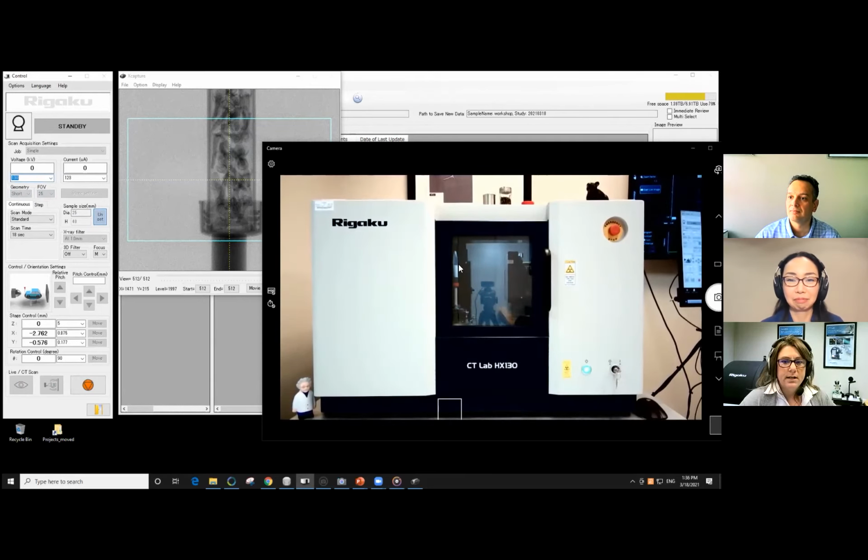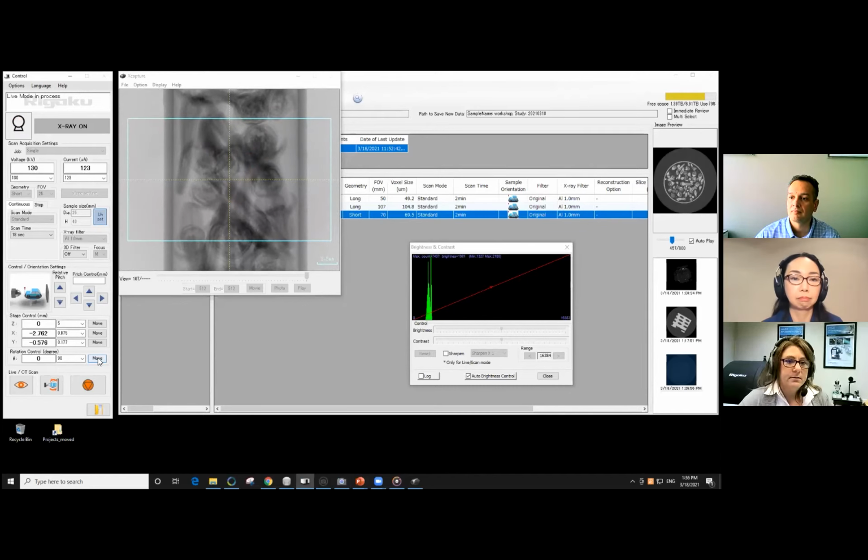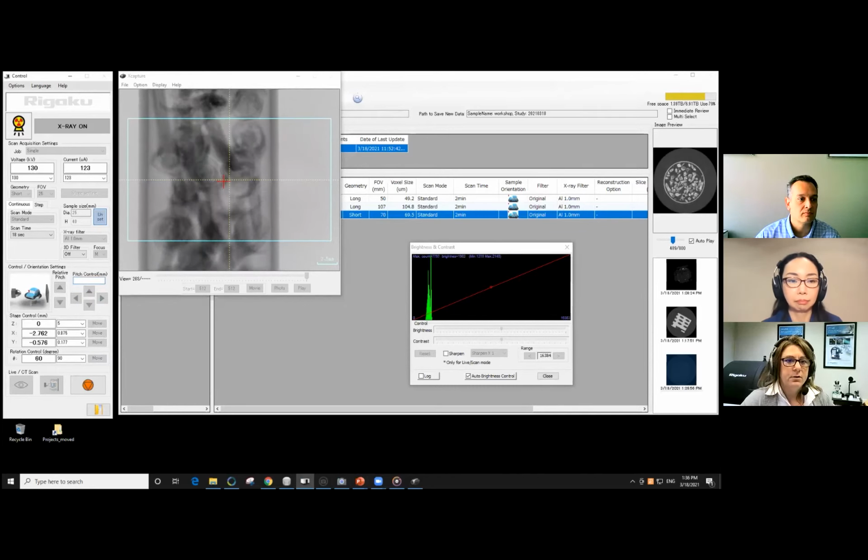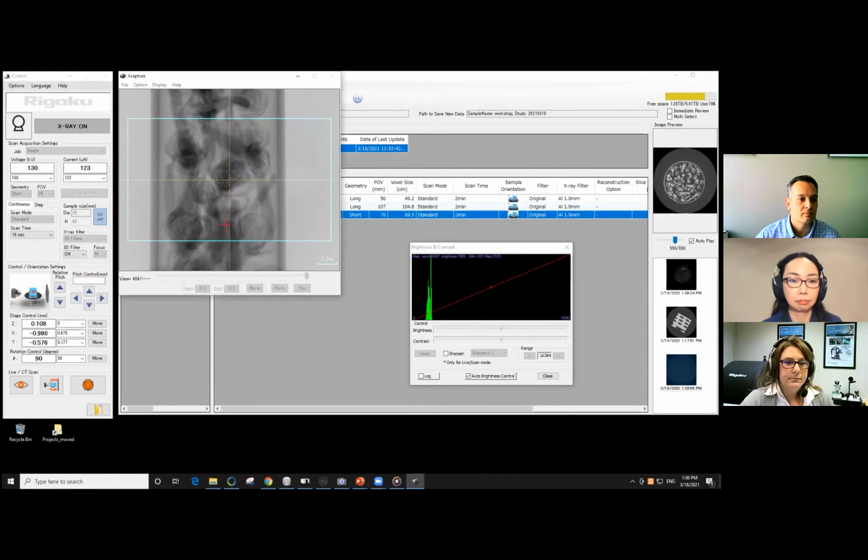See, it's moving it even closer. We know that our height may be wrong. So we're just going to adjust that here. Got to do that every time. Okay, so not bad. Let's rotate it 90 degrees, make sure everything stays in the field of view. And it should, it's pretty narrow. All right, we can move it a tad more if we wanted. Okay, they look like small flowers, don't they?